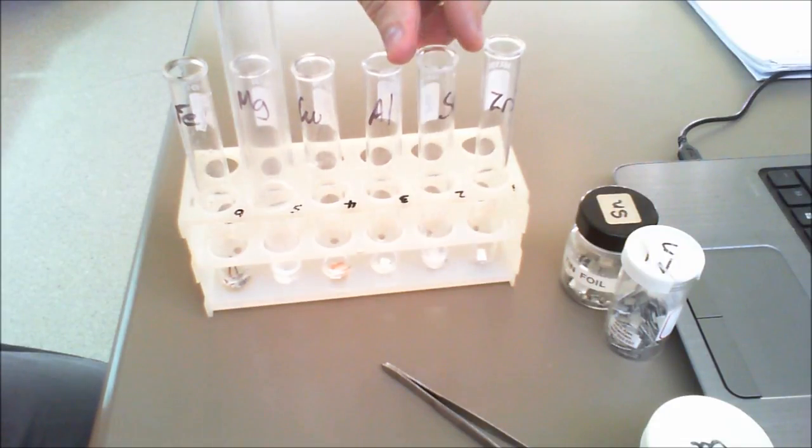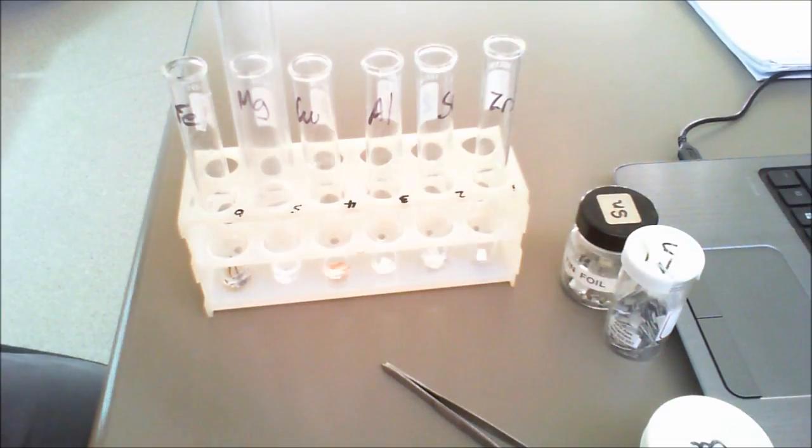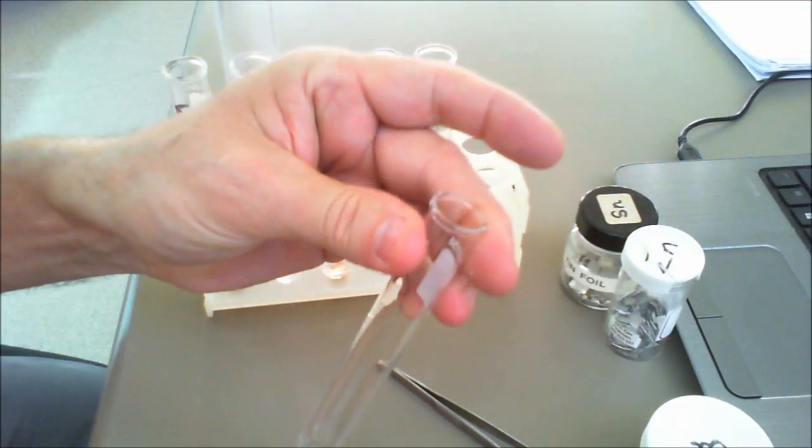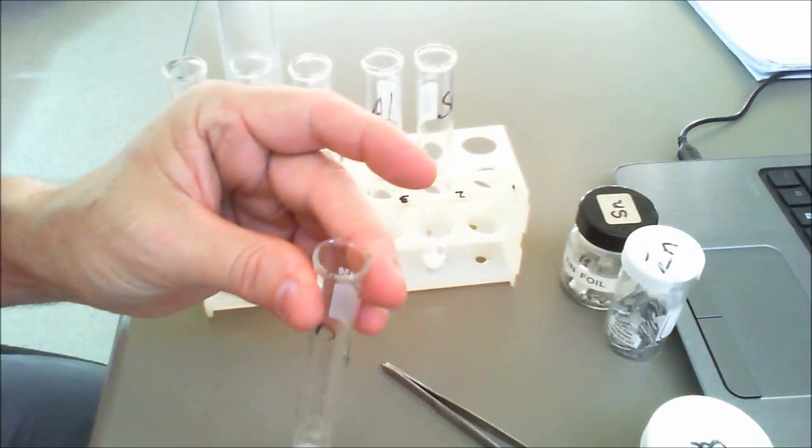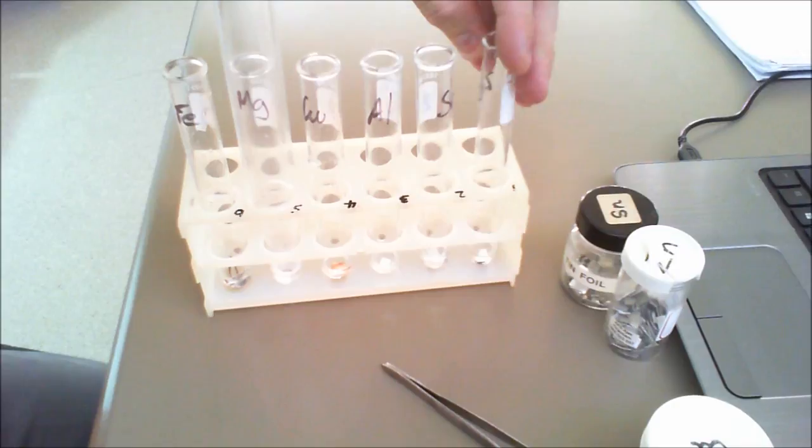And then our final one is zinc. And with the zinc there, yeah, there's some bubbles coming off. It's pretty hard to see when you look at it, but there's a few bubbles coming off and a few bubbles being produced there.